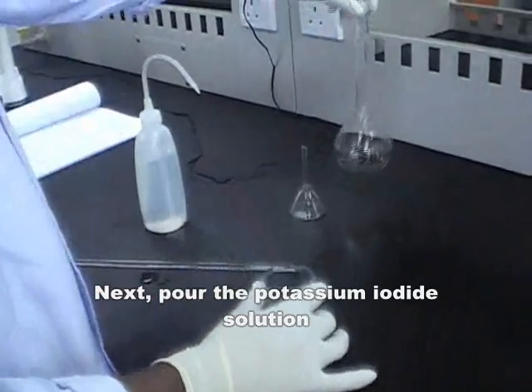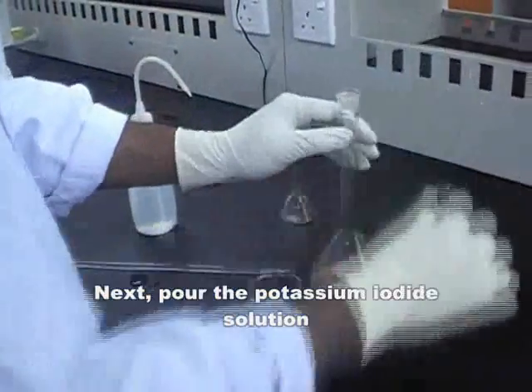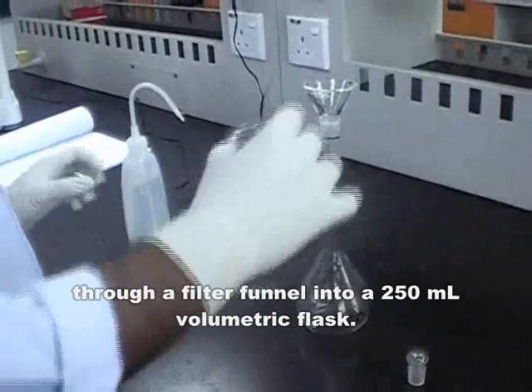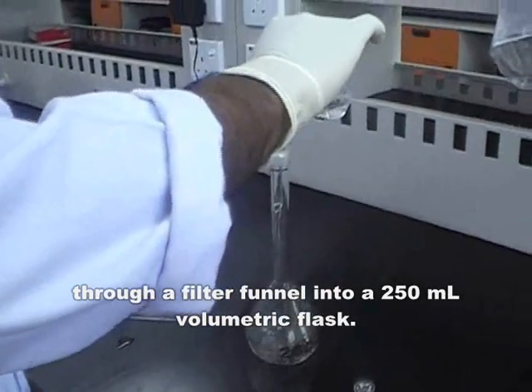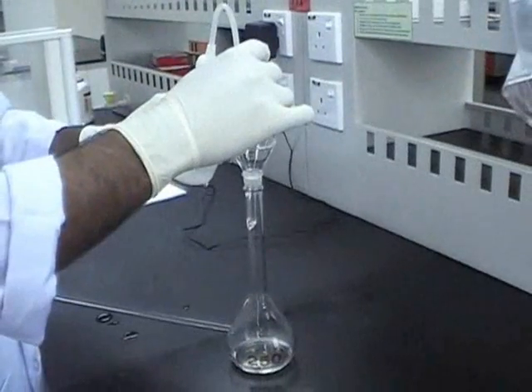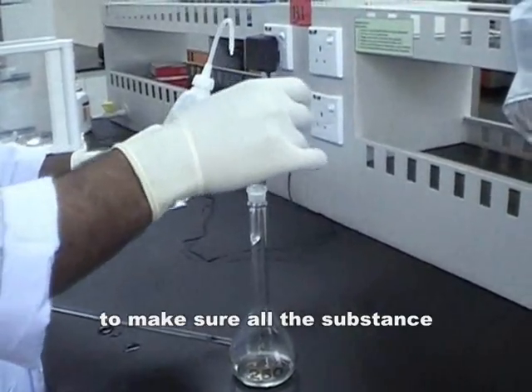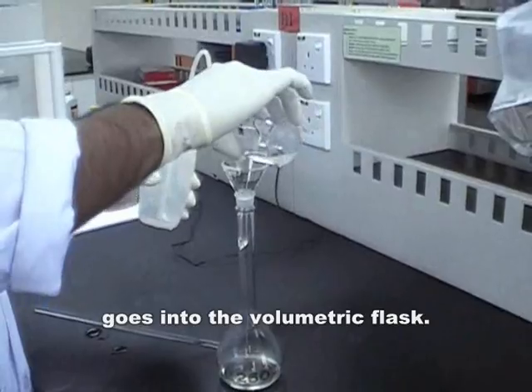Next, pour the potassium iodide solution through a filter funnel into a 250 ml volumetric flask. Rinse the beaker to make sure all the substance goes into the volumetric flask.